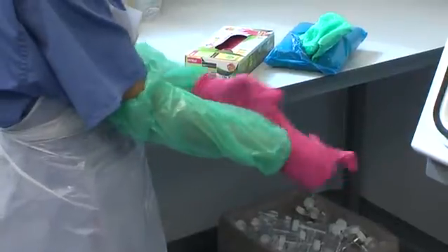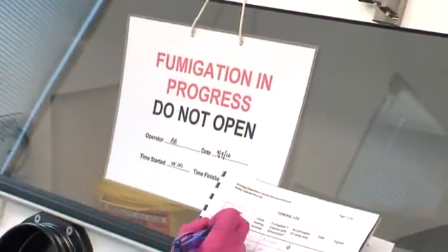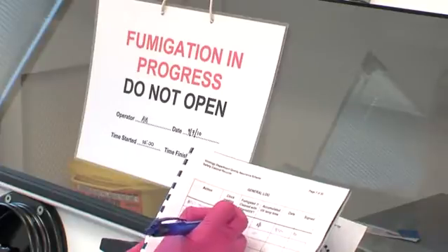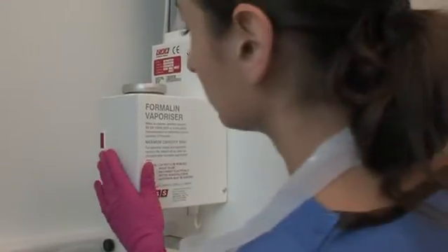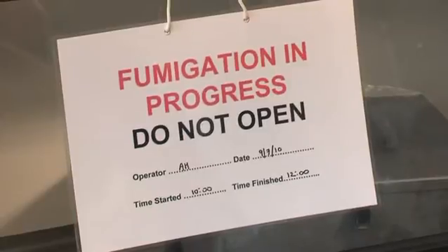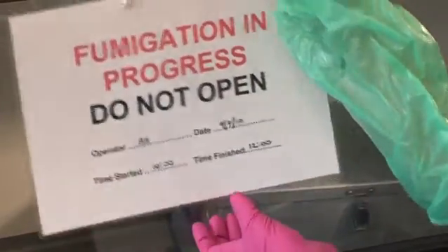When opening up a cabinet there are a number of checks to go through. The log book should be checked and filled in. Where appropriate staff must check the fumigation unit is turned off. The fumigation indicator must be checked to make sure the fumigation cycle was successful.